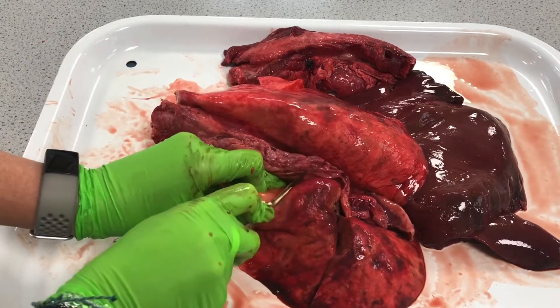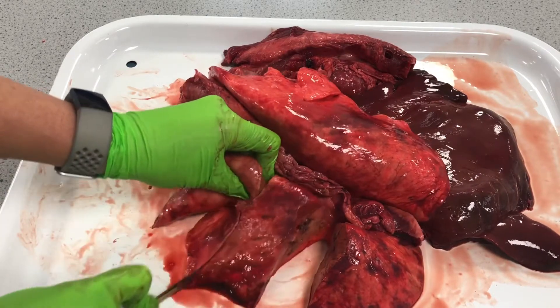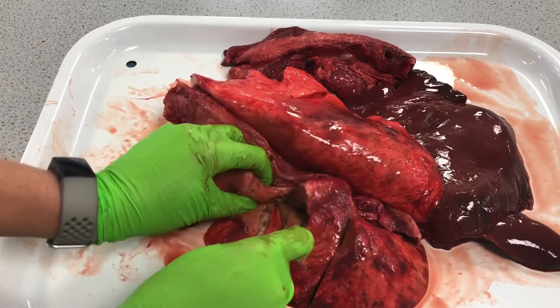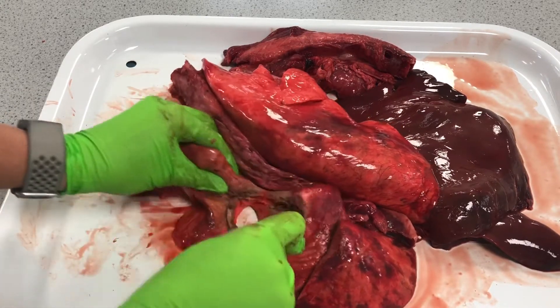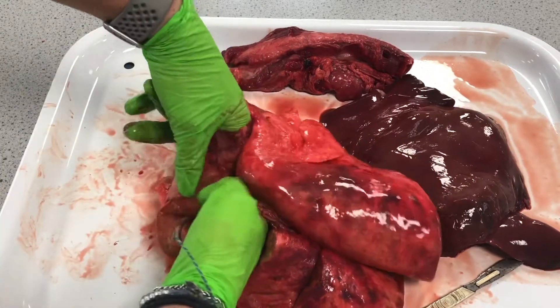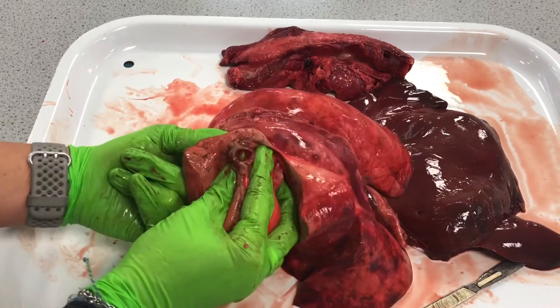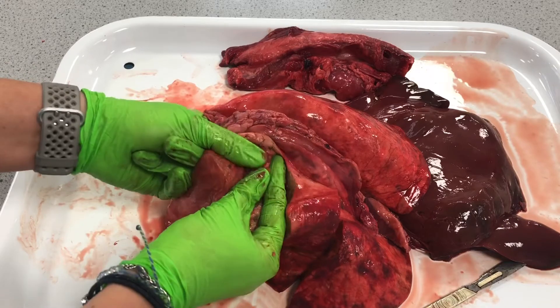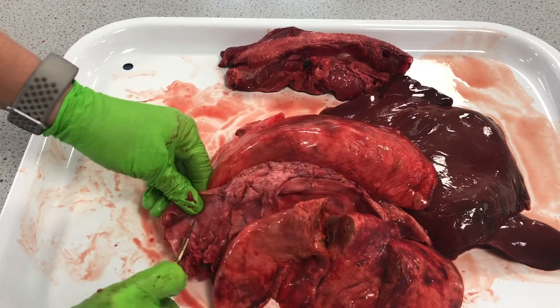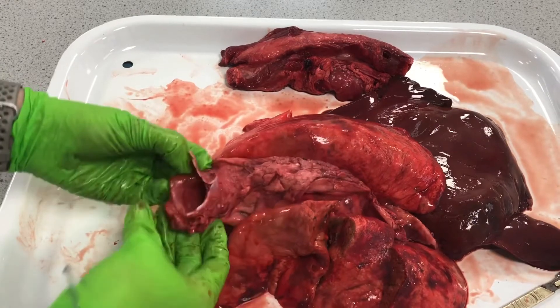Let's go a bit deeper in and see if we can get to the bronchi. It's really spongy — it is like a sponge — and it's also really quite smelly. It's kind of marshmallowy actually, if you're trying to think of texture. Here you can see more of those bronchioles. I'm going to try and feed in — you might actually see the green of my glove coming through the trachea. That's the first major bronchiole. Let's have a quick cross-section through the very tough cartilage of the trachea, just so you can see those rings of cartilage there.